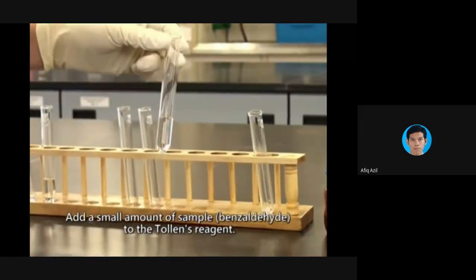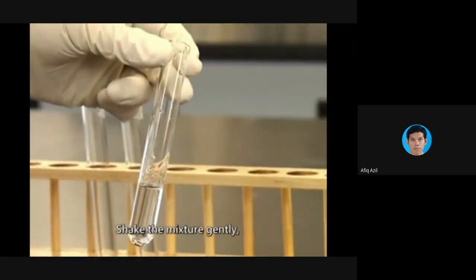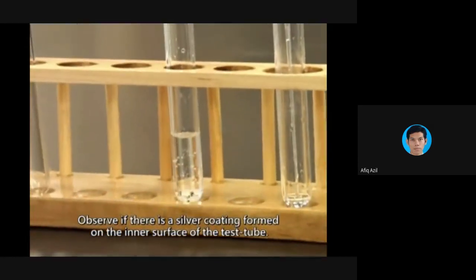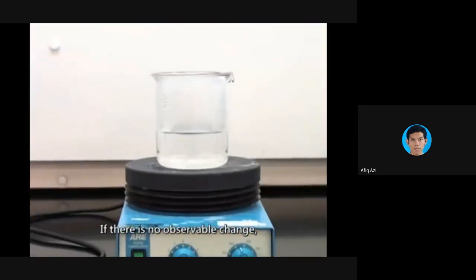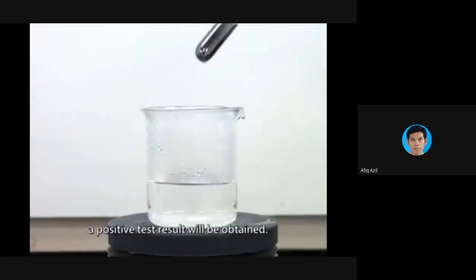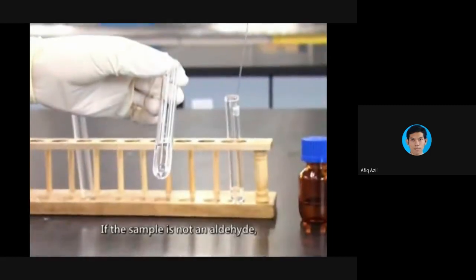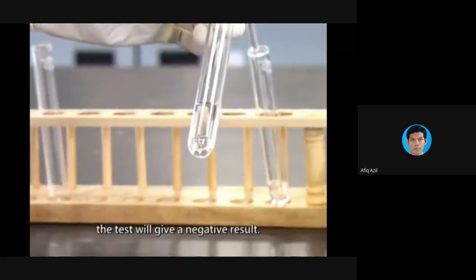Add a small amount of sample to the Tollens reagent. Shake the mixture gently, and then stand it on the bench for 10 minutes. Observe if there is a silver coating formed on the inner surface of the test tube. If there is no observable change, warm the mixture in a warm water bath for 5 minutes. If the sample is an aldehyde, a positive test result will be obtained. If the sample is not an aldehyde, the test will give a negative result.